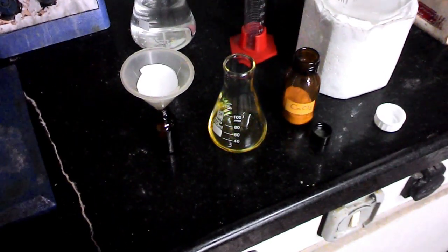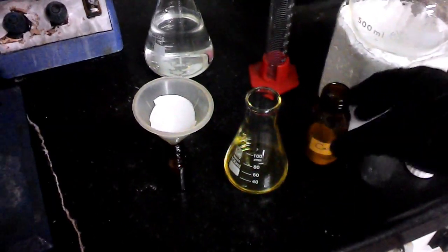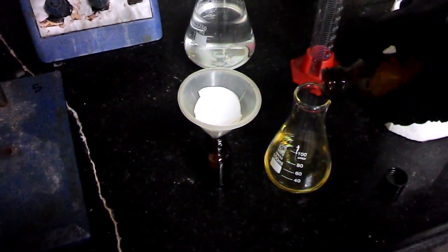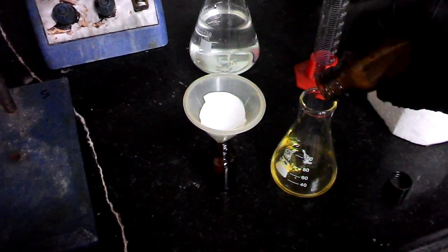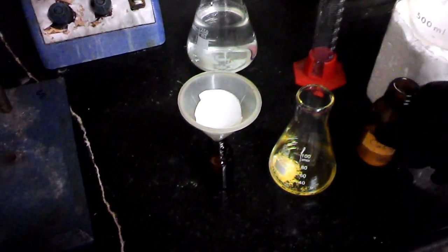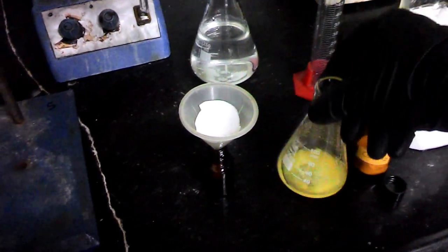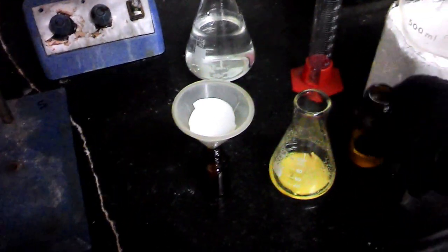And the last step, adding some calcium chloride to the product to remove the remaining water, shaking it, adding some more.